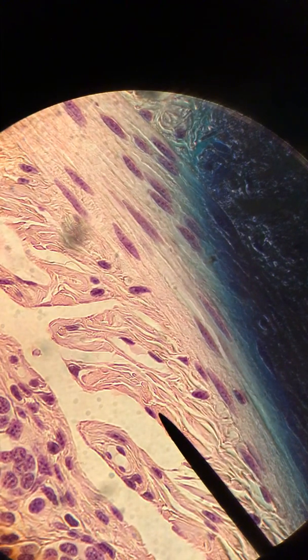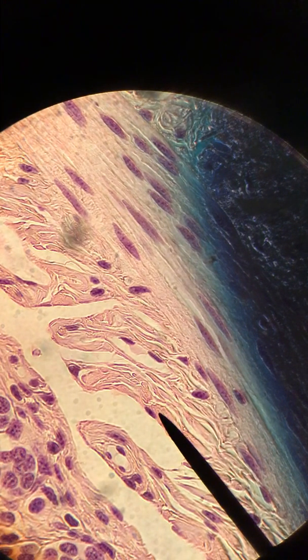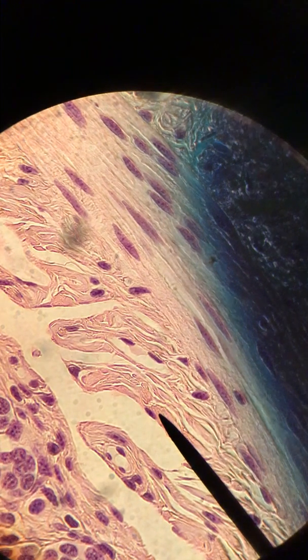Those are the things we wanted you to see in the small intestine slide. That's it for this one.